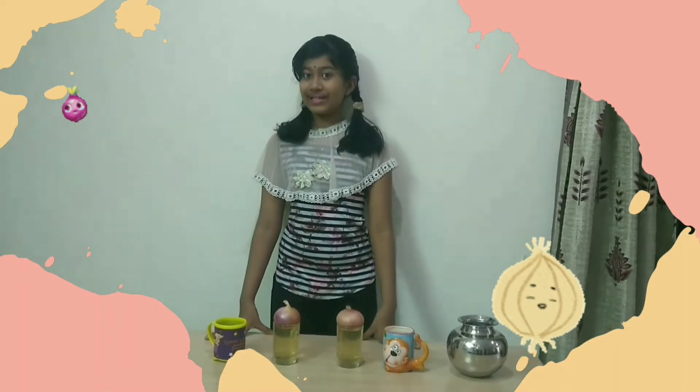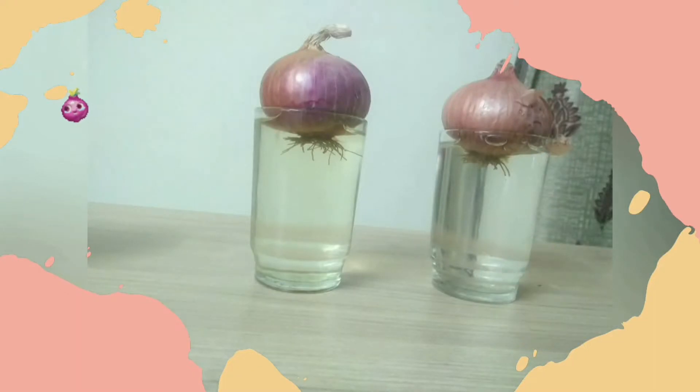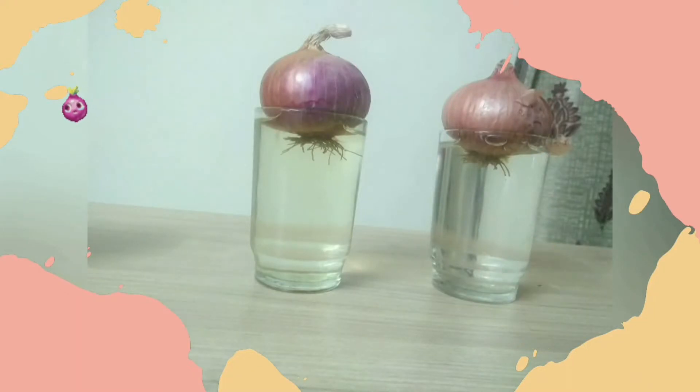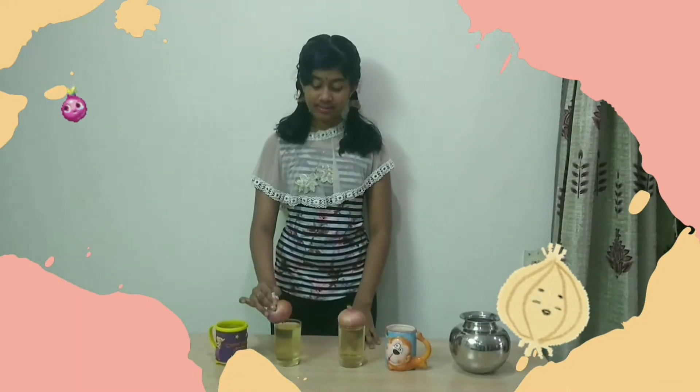After 24 hours of the experiment, I am going to observe if there are any changes in the roots of the onion bulbs. The roots have grown a little bit.